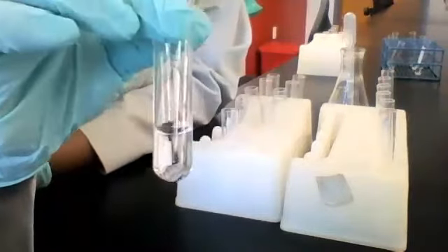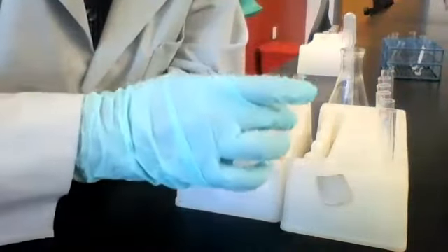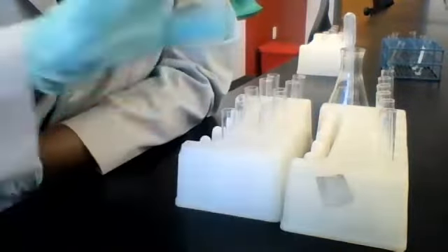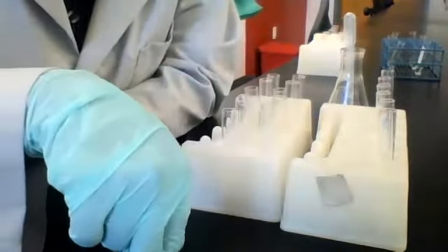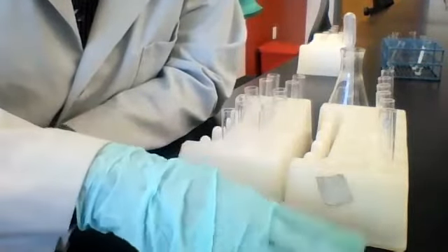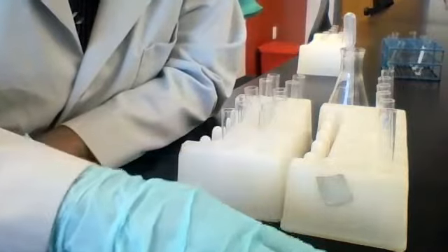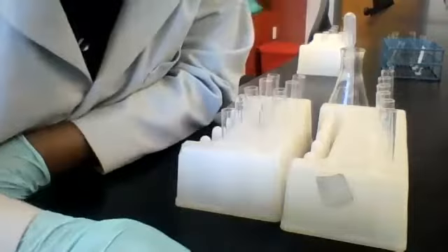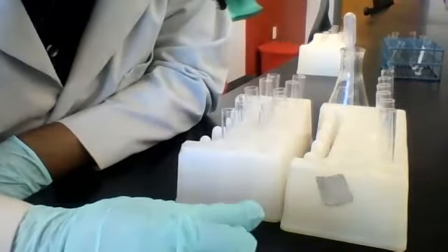All right, that's it for this part, reacting with sodium hydroxide. I'm about to write these last two in the chat, but if you have any questions before we move on to the third reagent, you can unmute and let me know or put it in the chat and I'll address it when I see it.